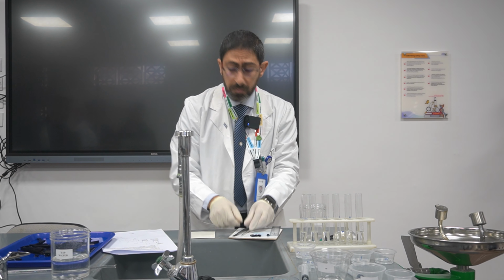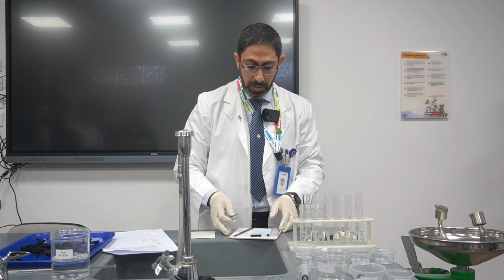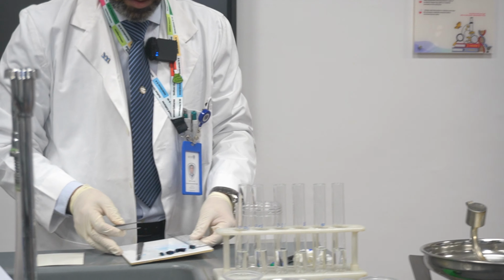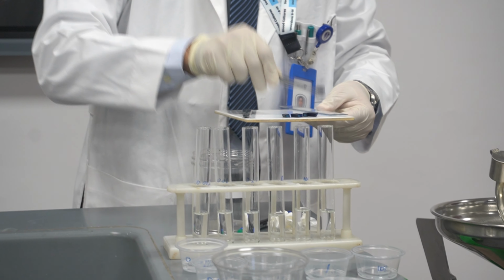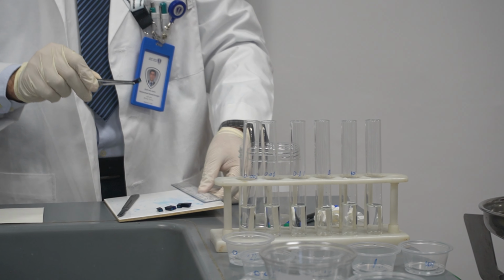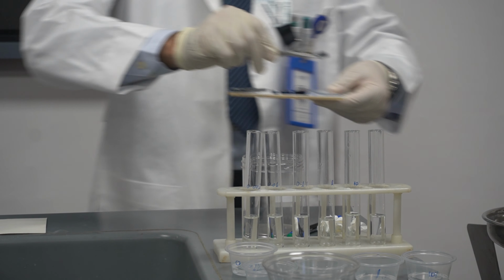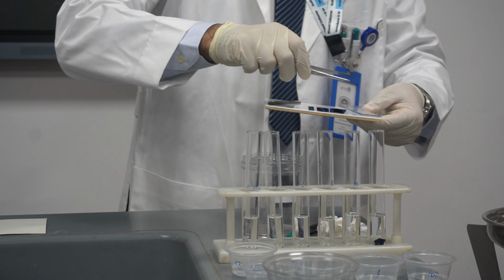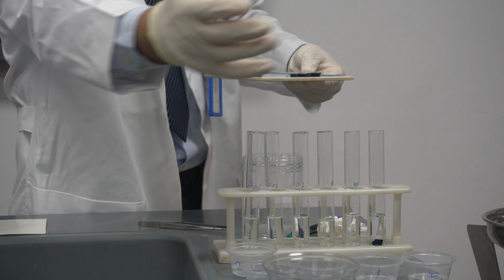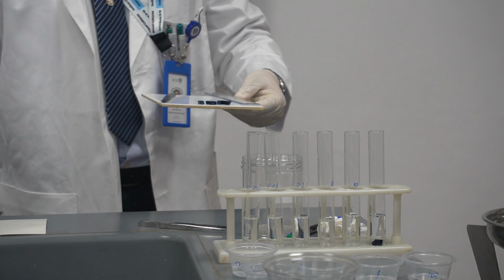Even those. Now I'll take each piece and dip it into one of those test tubes. Okay, I have 6: 1, 2, 3, 4, 5, 6. So I have to use the stopwatch. Okay, 10 minutes, and afterwards I'll continue the experiment. Use the stopwatch, please. Thank you. Yes, it's now on.